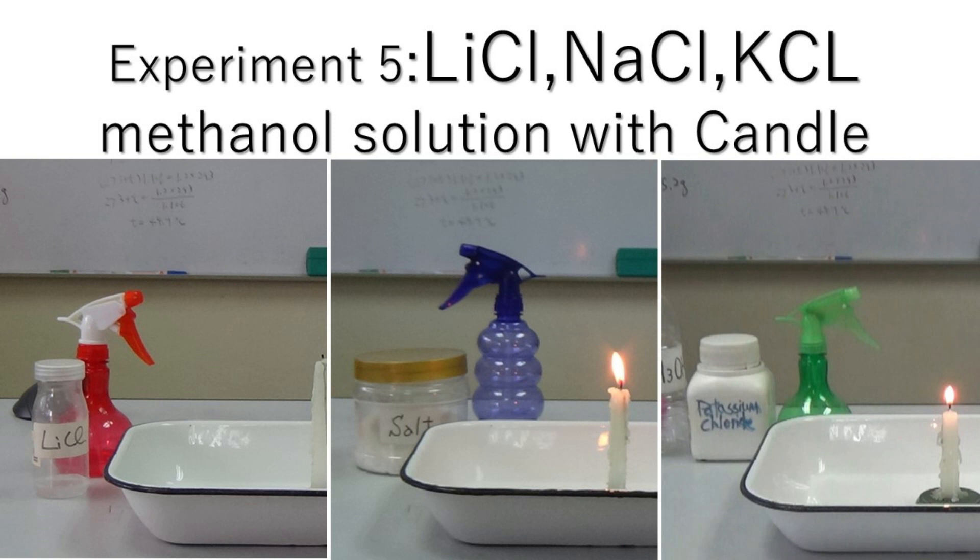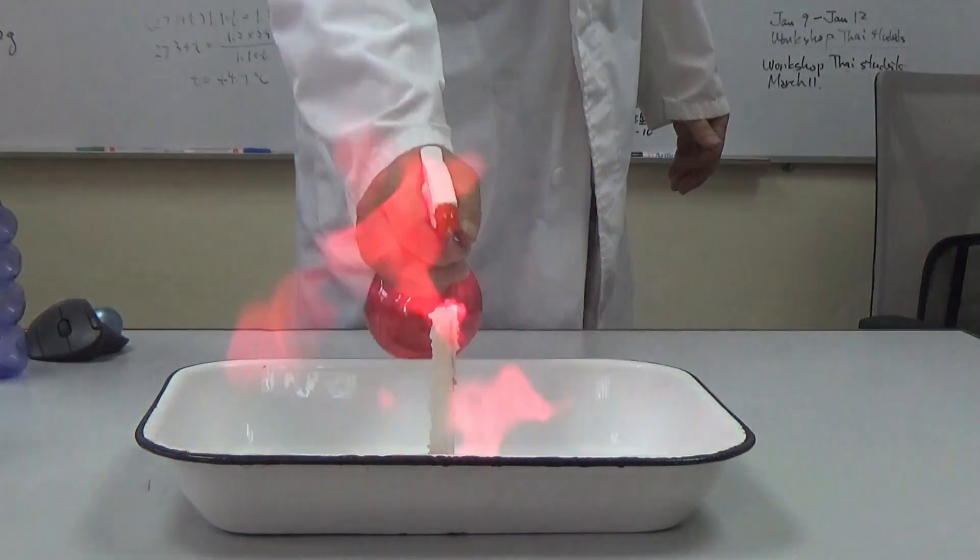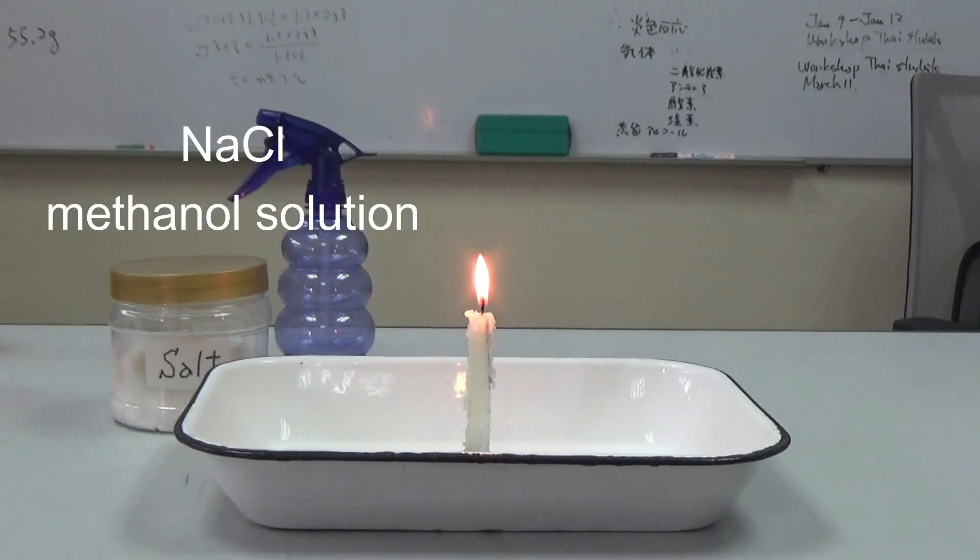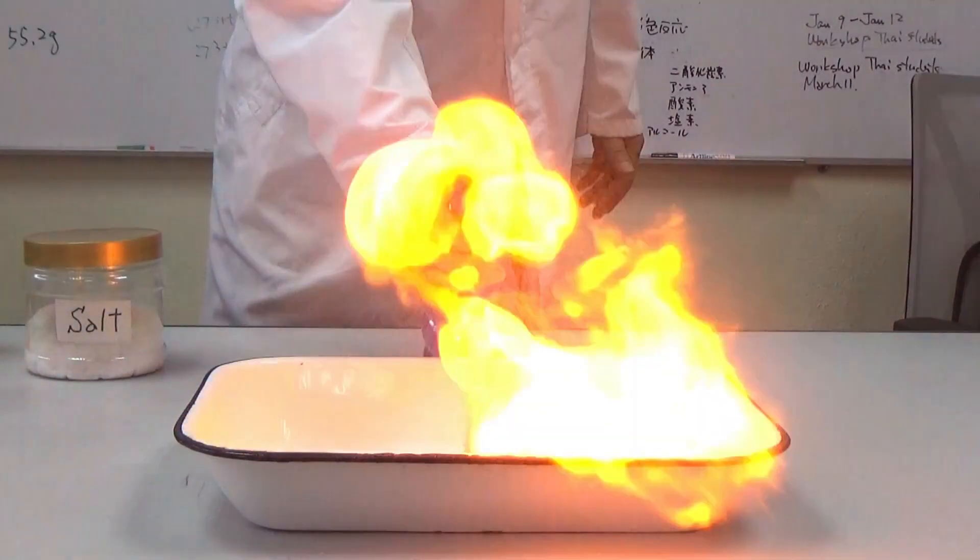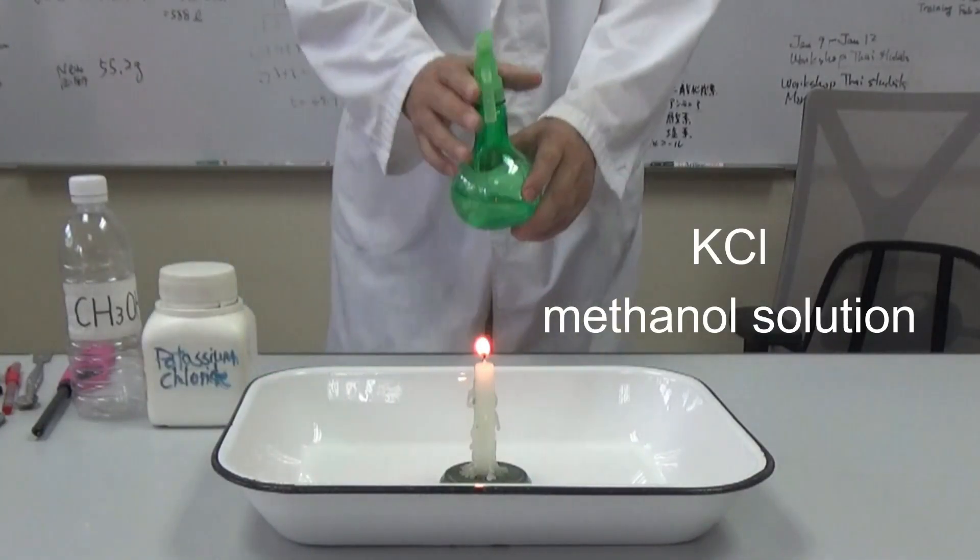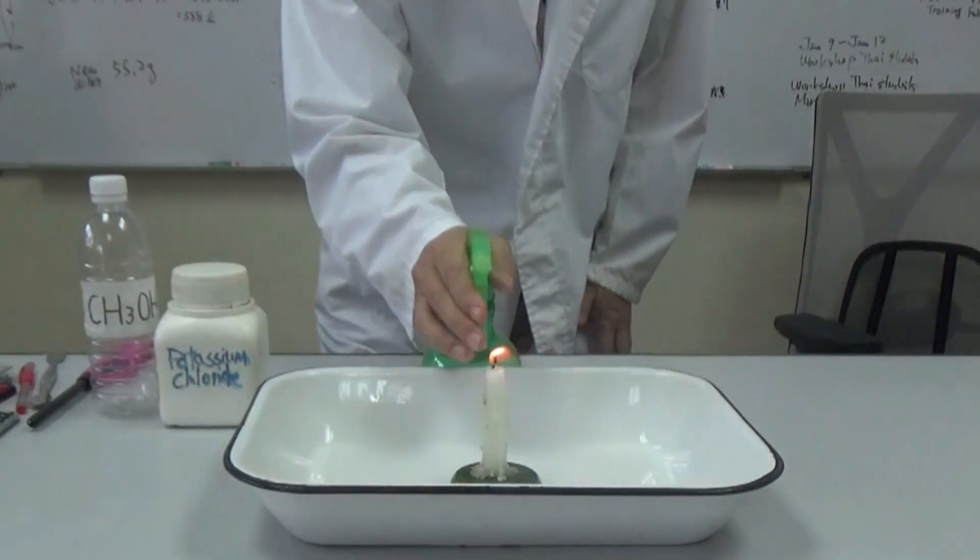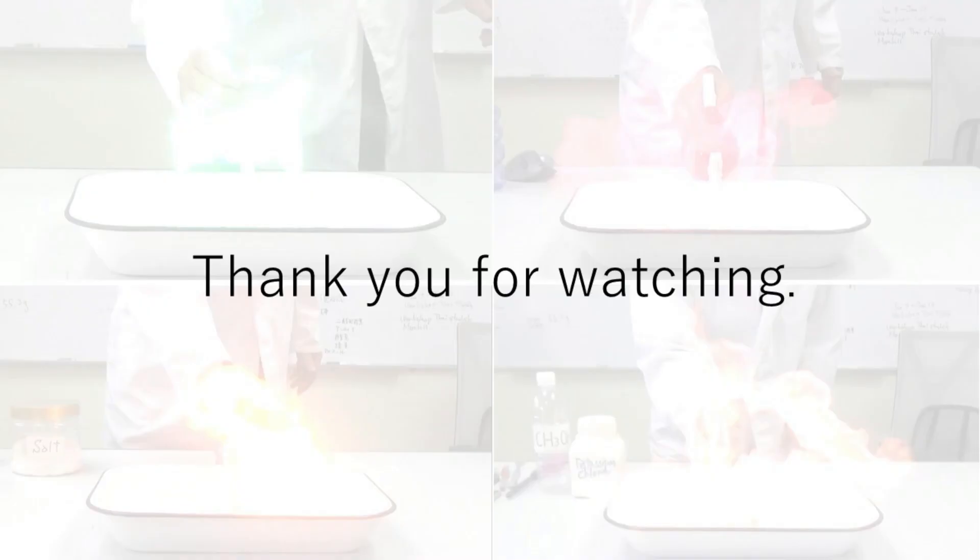Observe the flame reaction of lithium, sodium, and potassium using methanol solution. Thank you.